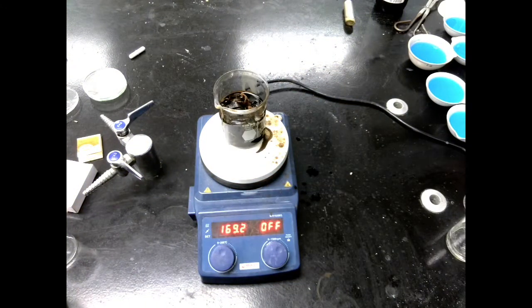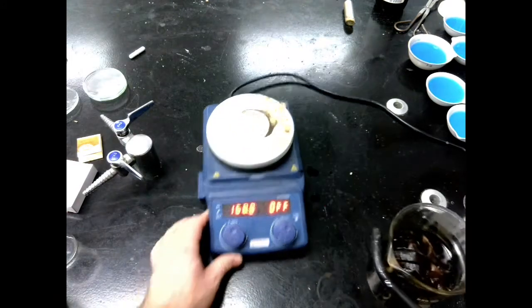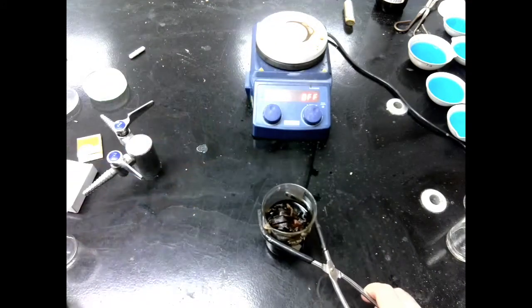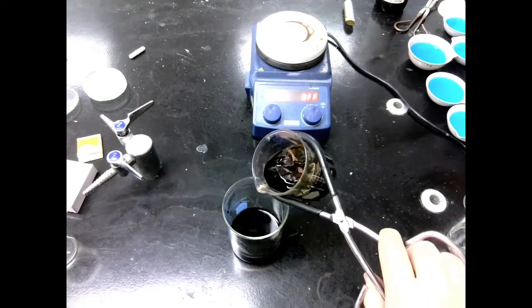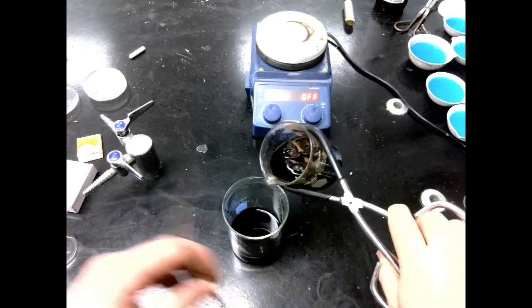Once everything's ready, we're going to pull this back out and do the same thing again. We're just going to keep all of our concentrated tea, and by doing this, we should collect all of the caffeine out of the tea bags.